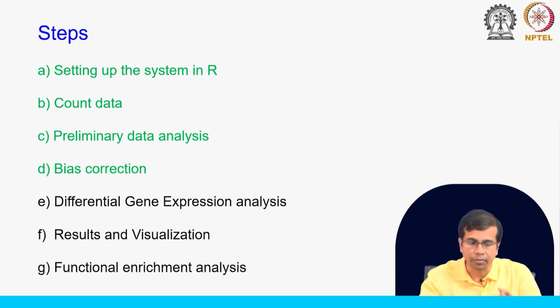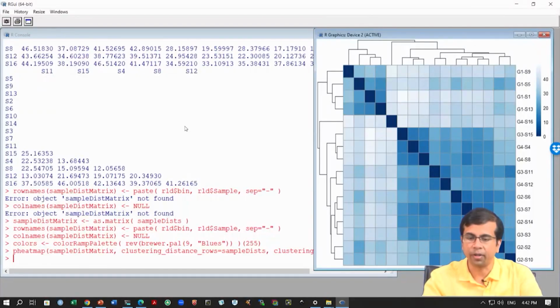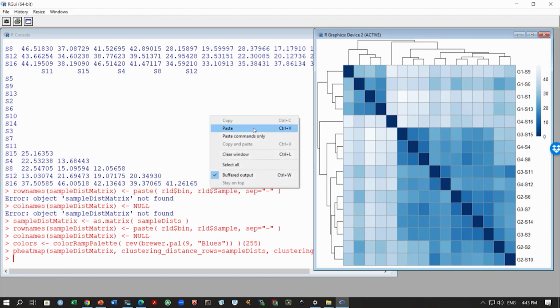Okay, so let us move to R and let us complete the preliminary analysis part and see if PCA gives us the same data as the distance based clustering method, and then we will do the bias correction. So, let us move into the R terminal. Here we are from the last class. This is where we ended, and we can now generate the PCA plot.